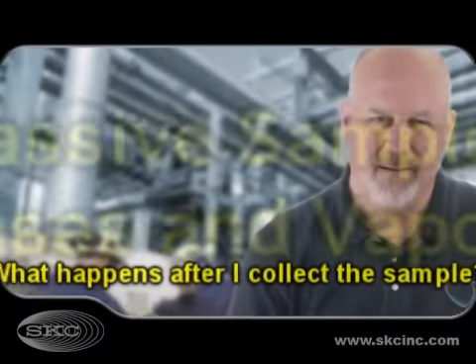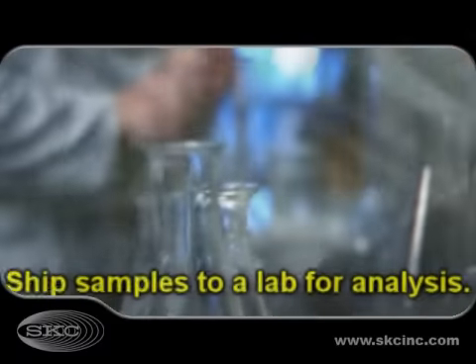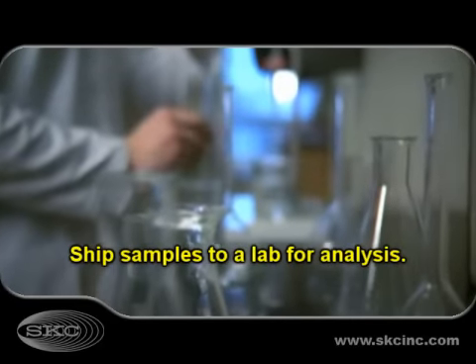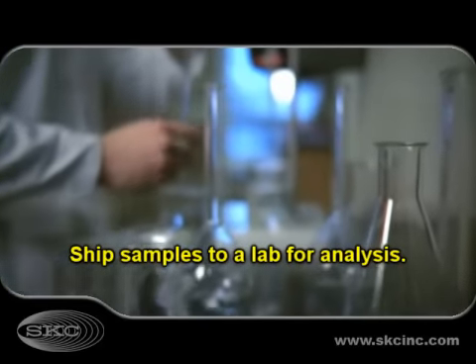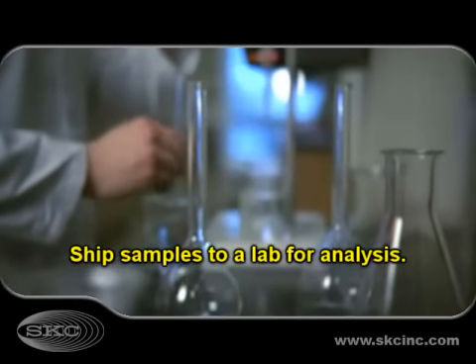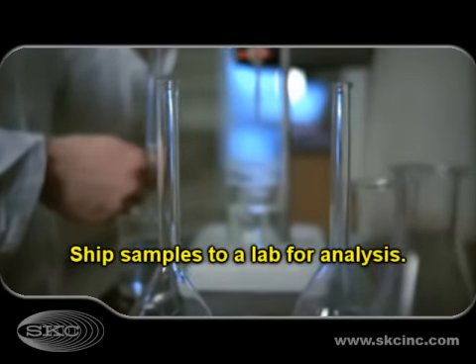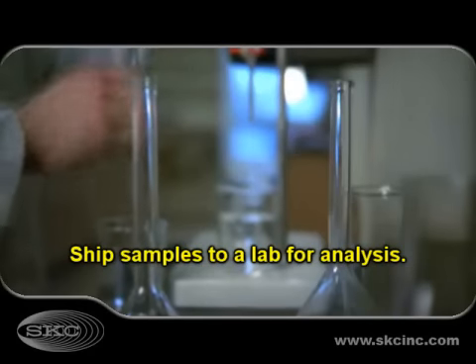What happens next? Ship samples to a laboratory. The laboratory analyzes the samples. Compare results to exposure limits established by regulatory authorities or other agencies.